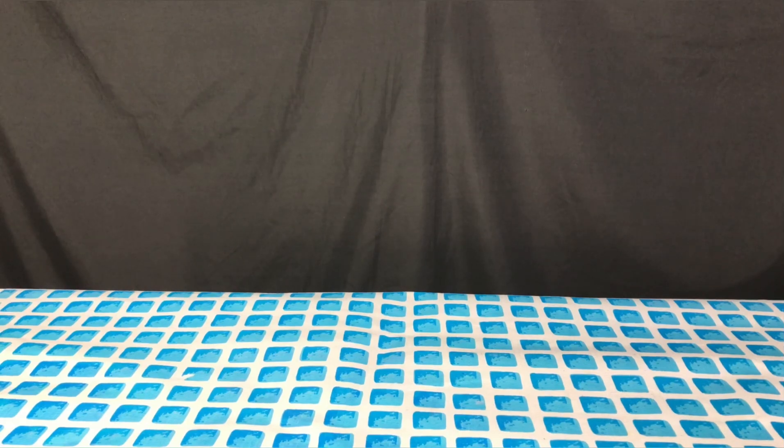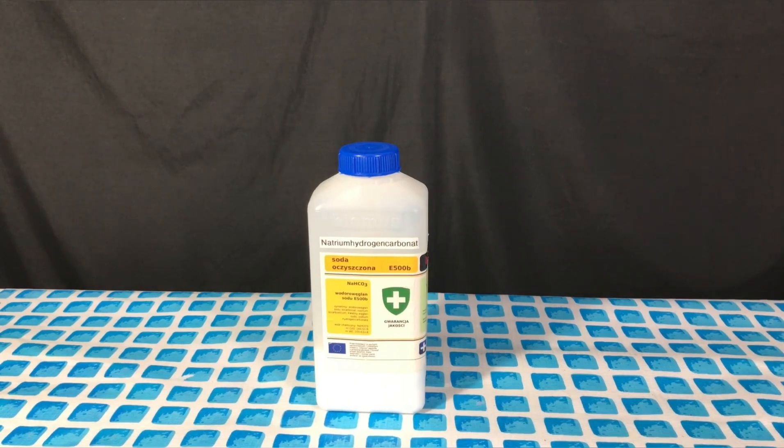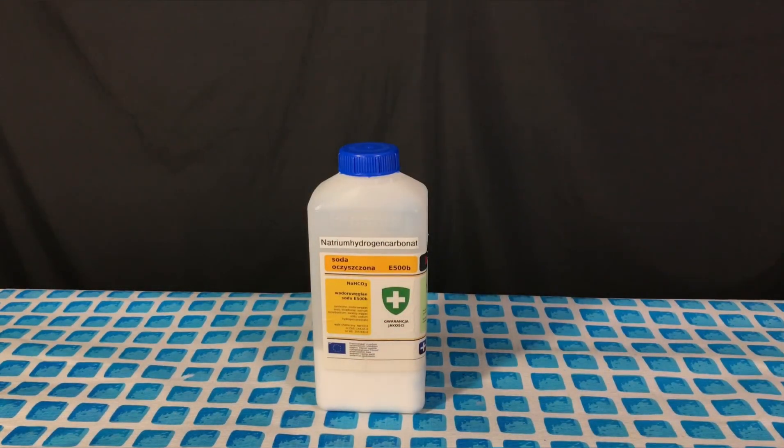Welcome back everyone, today we are going to make sodium carbonate. For this only 84 grams of sodium bicarbonate are needed.